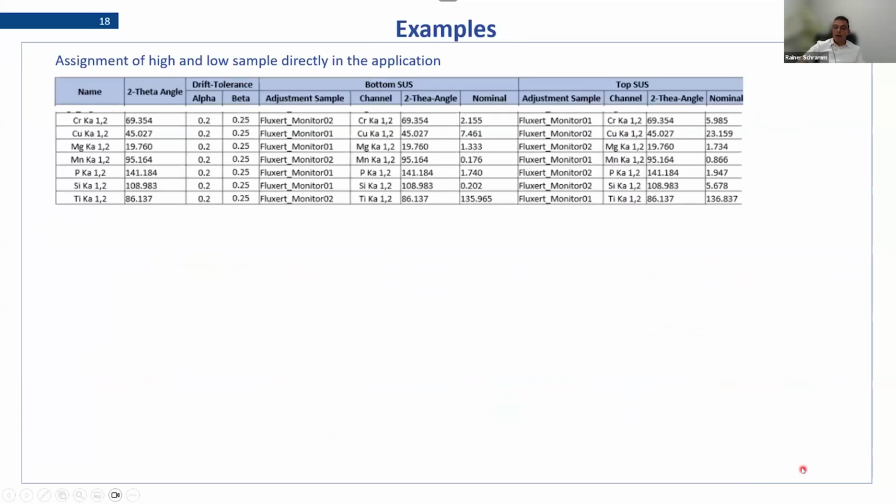Yeah, and then the examples of how this is really performed in your software. There are 2 different ways to do this. One way is that you directly define in your application, you link your corresponding line with the drift sample. Like here in this example, it was linked to a bottom SUS and a top SUS. That means a low drift sample and a high drift sample. And you see here, this was the intensity measured for the low and the high. And then the system calculates with the 2 values the drift correction for this line in this application.